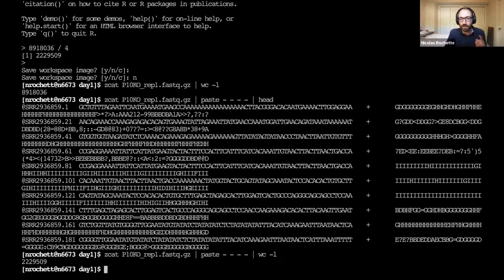That said, the easiest way to look at your FASTQ files is to ask a bioinformatic tool to do things for you, and that's what we're going to do now: using FastQC to ask a number of questions about our FASTQ file. One thing I can mention though is this command here at the end of the screen. That's typically something that I use when I get data back for a number of samples. It's a very quick way of confirming how many reads I have exactly for each of my samples, which is the most basic information you want to start with.